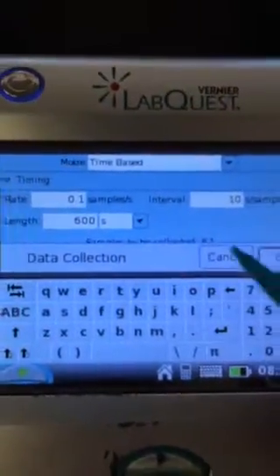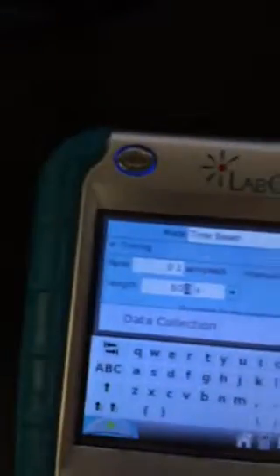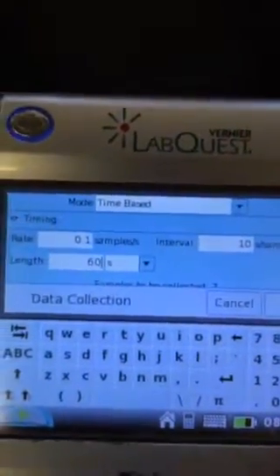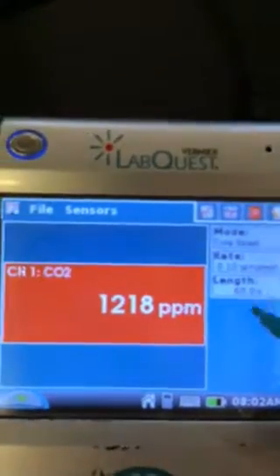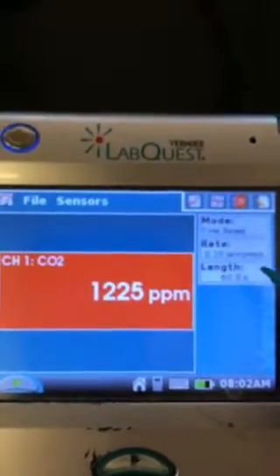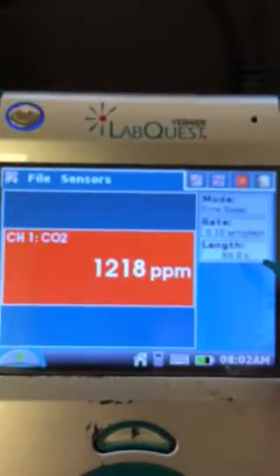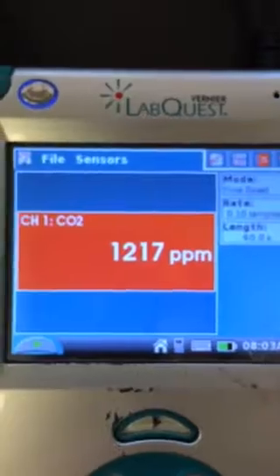And I'll hit OK. I'll change one other thing, and that is how long I want it to record. I don't need 600 seconds, that's like 10 minutes of recording. Instead, I'll just make it 1 minute, and I'll hit OK. So if I've made it one measurement every 10 seconds, and I let it run for 60 seconds, it's going to take a total of 6 samples.